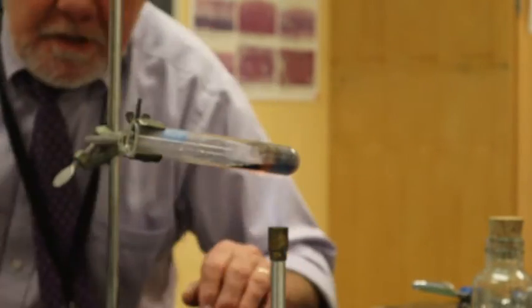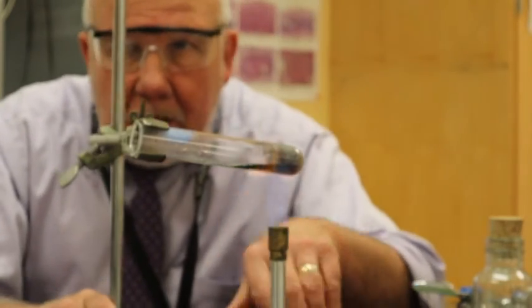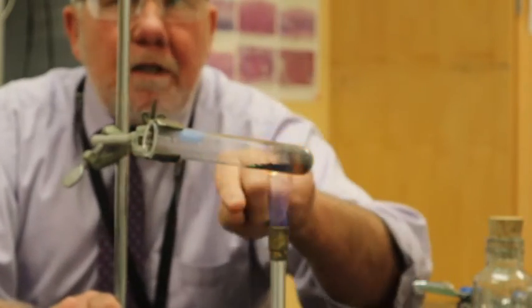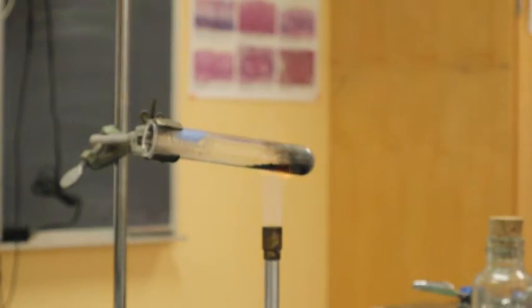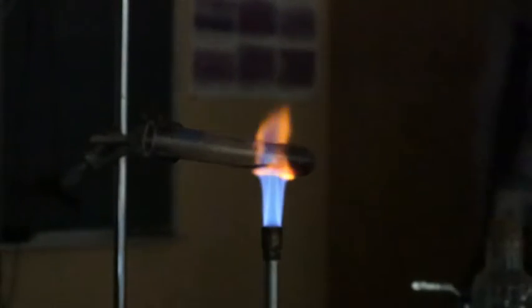All right. Well, it seems to be, yeah, if you look right in here, it's all what looks like liquid water. I'm stirring this up. A lot of it's black. I see very little green there. All right. Let's turn off the light so you can see what this looks like. It's out. All right. Let's see how that shows up.